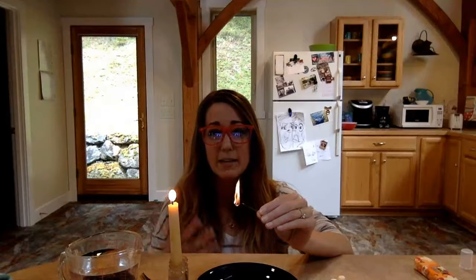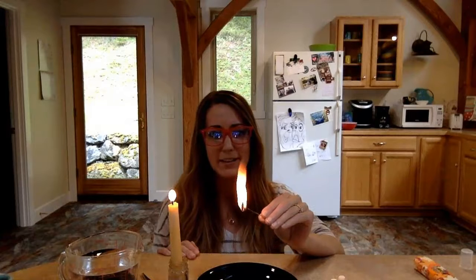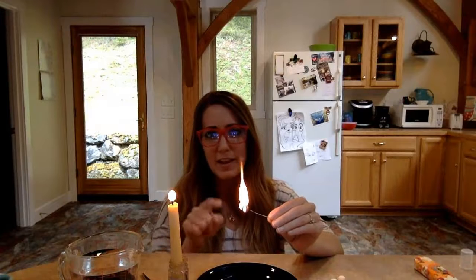So you'll remember from science last year, when we were studying the digestive system and proteins and fats and the different nutrients in our food, that nuts have a lot of good fat in them. Look at how high the flame is. Okay, so stand back. I should have ponytailed my hair. What was I thinking? But look, that means when I eat cashews, how much energy is it going to give my body, compared to that marshmallow, right?